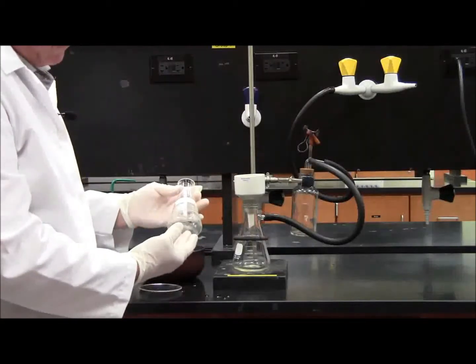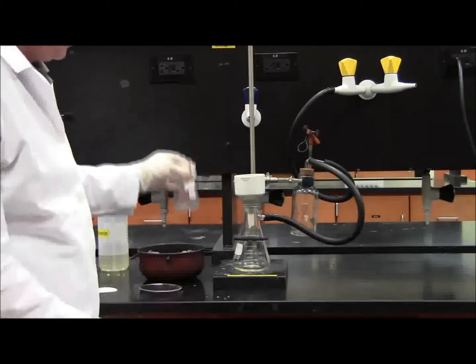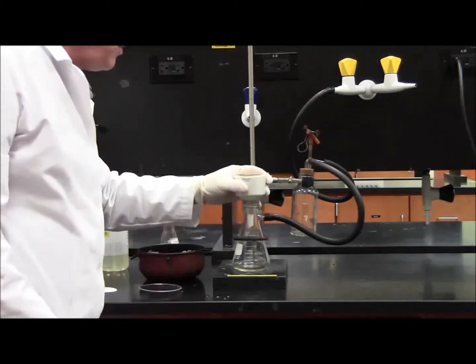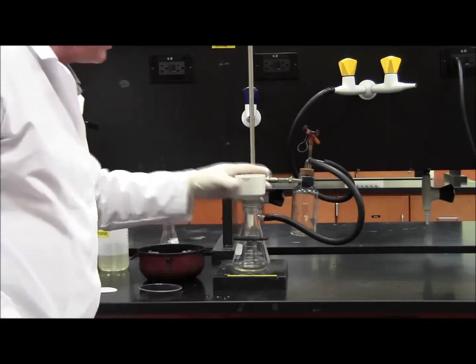You see how most of the crystals have been transferred. Then you're going to let the vacuum run for about five minutes to try to dry the crystals.